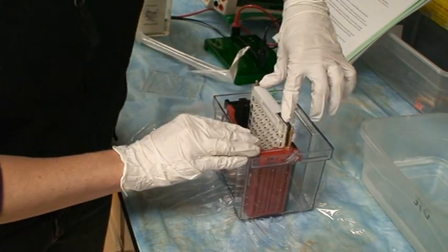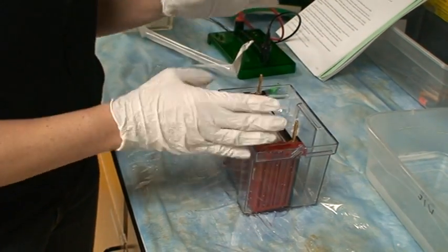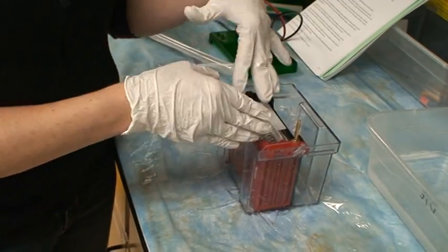And you're going to have two of these cassettes in each box because you had two groups with two gels. And so you have two groups with two cassettes in here.